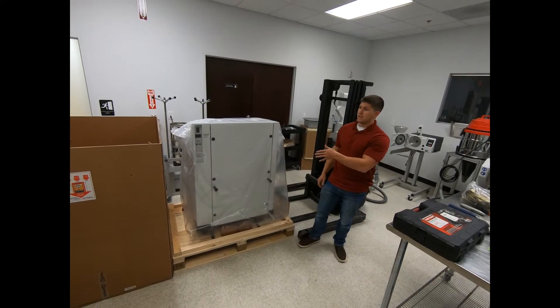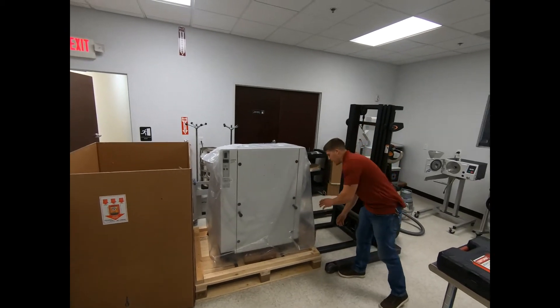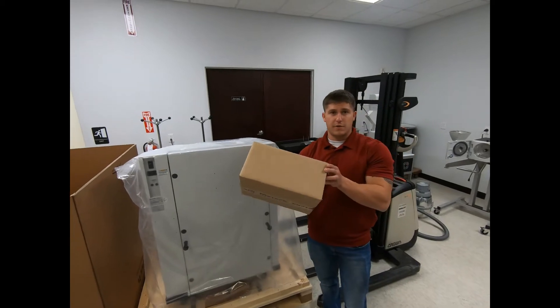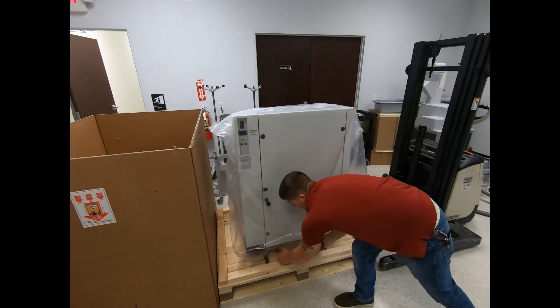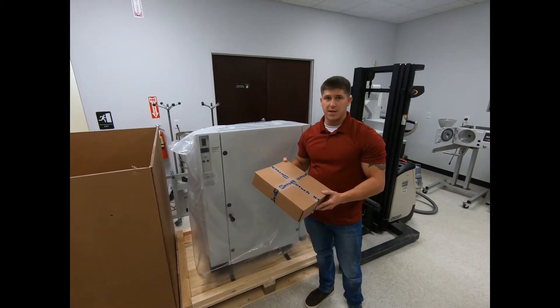Once you carefully take the box cover off the unit, what you're going to find on the pallet is two boxes. One box contains the carry handle for the grinding set, and the second box located underneath the unit itself is going to be your power cord and operating manual.